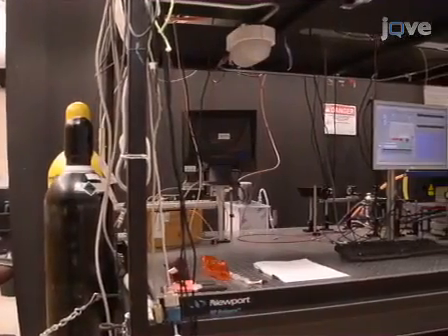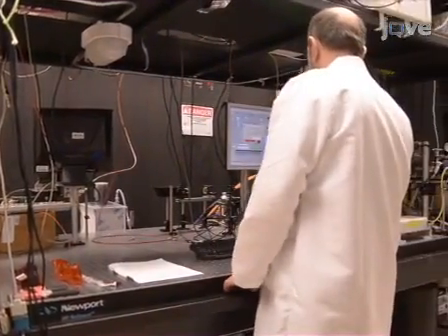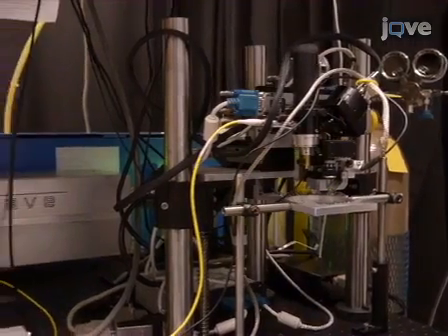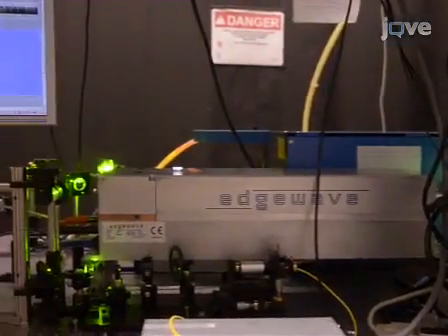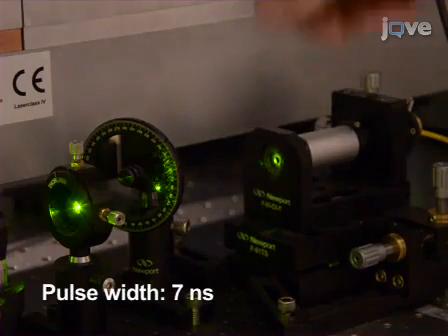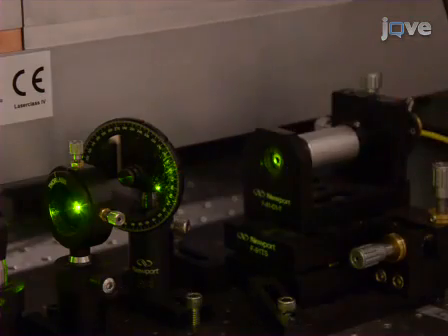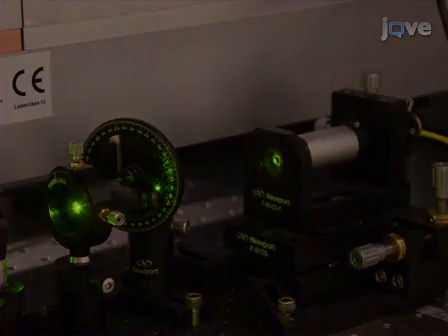Optical resolution photoacoustic microscopy, or ORPAM, consists of both optical and ultrasonic components. The optical irradiation source is a dye laser pumped by a solid-state pulsed laser. The output laser beam is attenuated by a neutral-density filter and coupled into a single-mode optical fiber for light delivery, to allow mechanical scanning of the microscope imaging head rather than the sample.